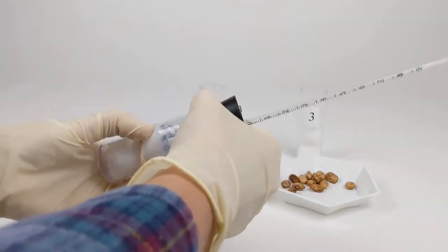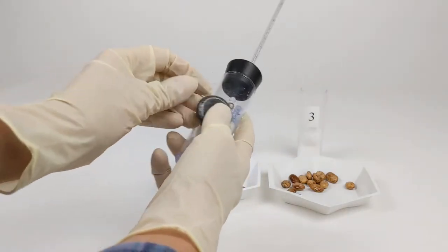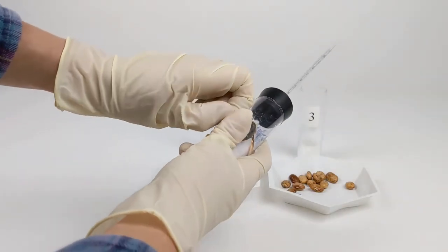Then we're putting a rubber band around the vial which will hold a weight. The weight will keep the vial submerged when it's in the water bath later.